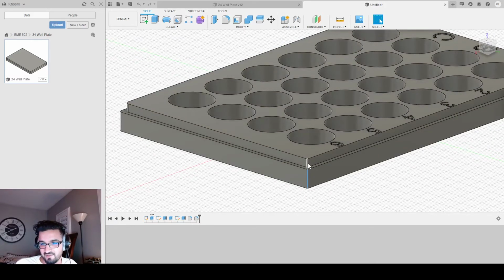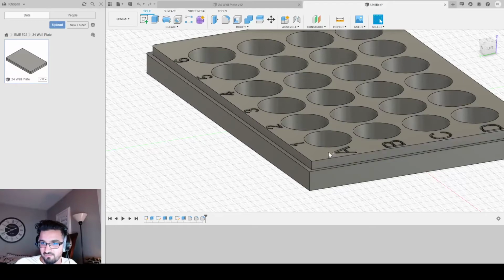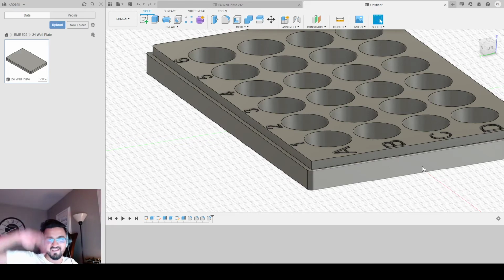I'm going to select these 2 and fillet by 1.5. We do the same thing here. Fillet this by another 1.5. And at the top corner where the A and 1 meet, I'm going to fillet only the bottom, by 1.5. And the reason for that is when you look at any 24 well plate, you'll see that one corner has that slant to kind of identify physically that this is the different corner from all the other corners. So this is the right side up or the right orientation.